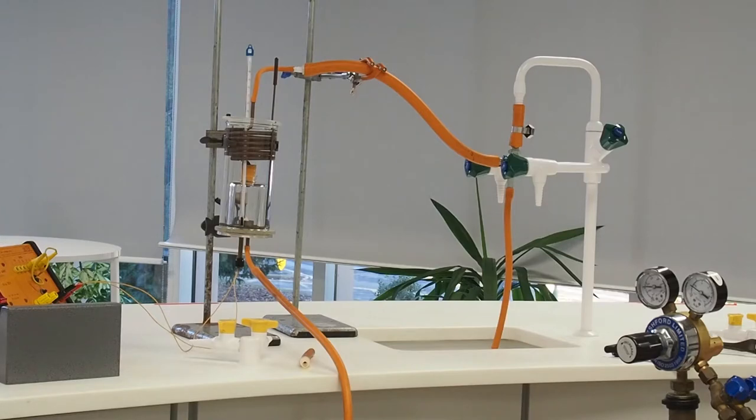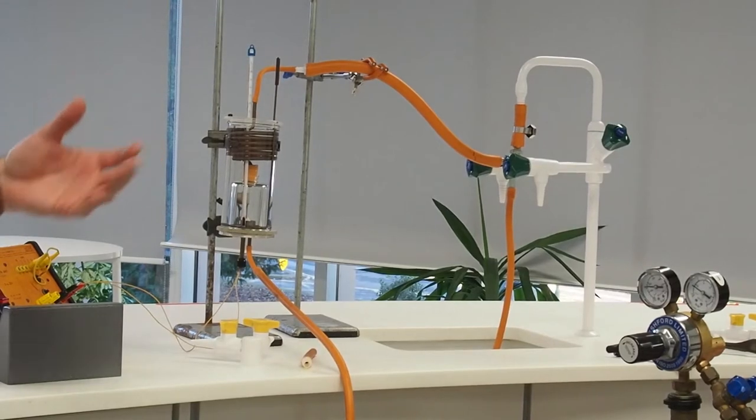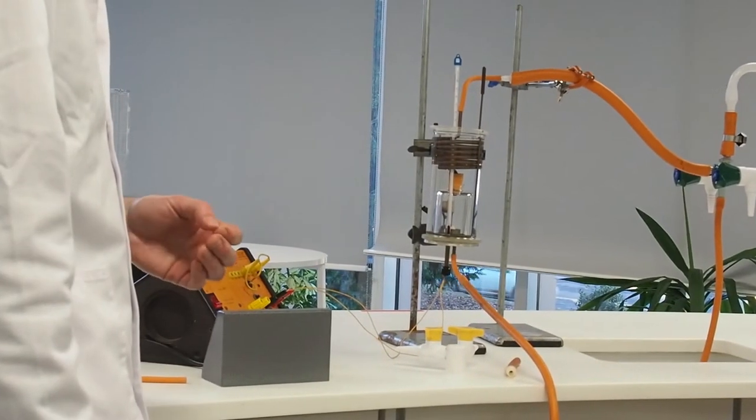The last piece of equipment that I have then is a power pack which I'm going to use as an electrical source to heat the food to stimulate our flame to get the food burning.